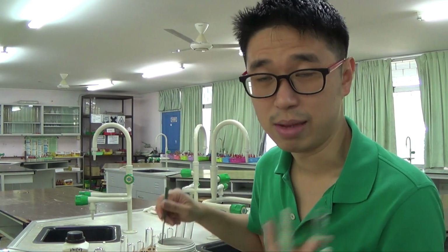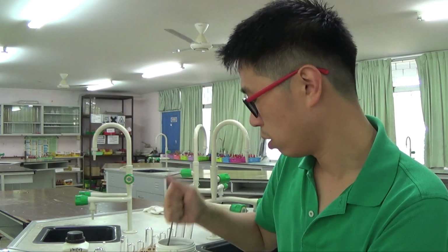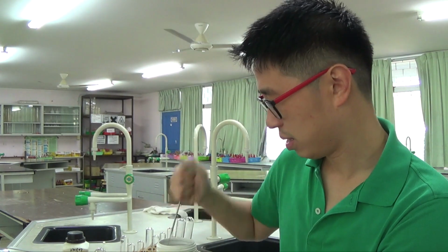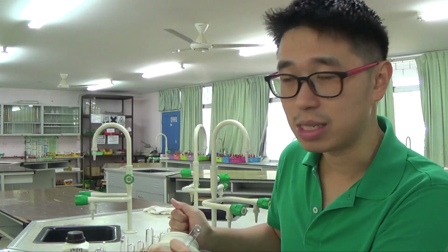So obviously in an exam setting, they'll provide you in small vials a little bit of the solid, or they might already make up the solution for you. But you can never discount the fact that they can give you the solid and they expect you to test for the solid. So before you test for anything, you have to dissolve it in distilled water.